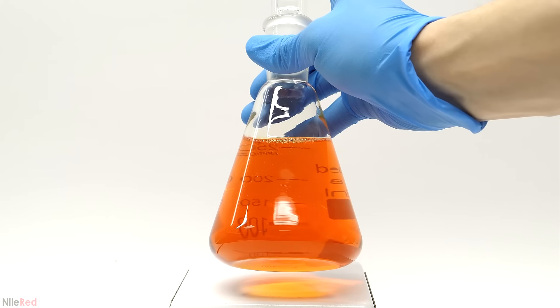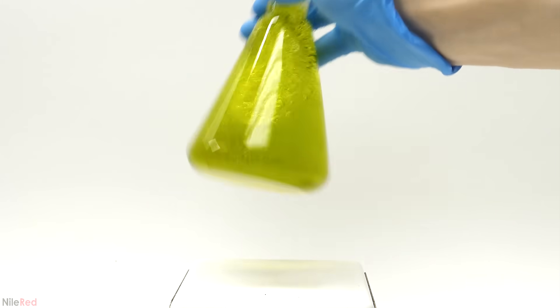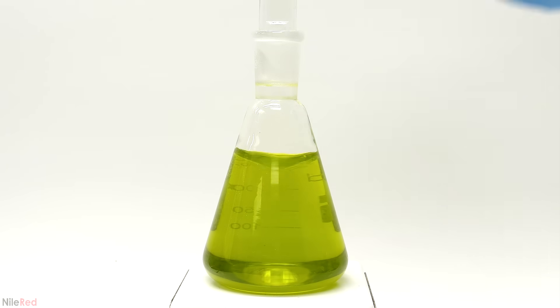What's cool though is that the reaction isn't done yet. And if it's left to sit undisturbed for a few minutes or so it reverts back to being red and then to yellow. It can then be shaken again to change the color and the process can be repeated several times.